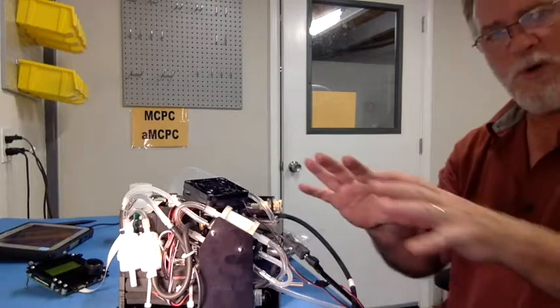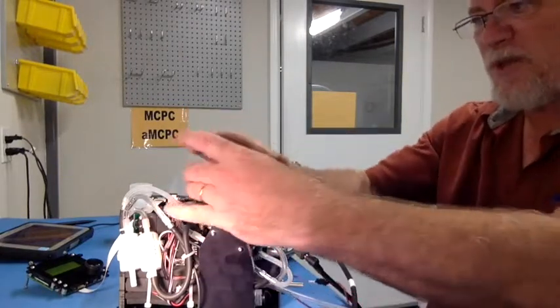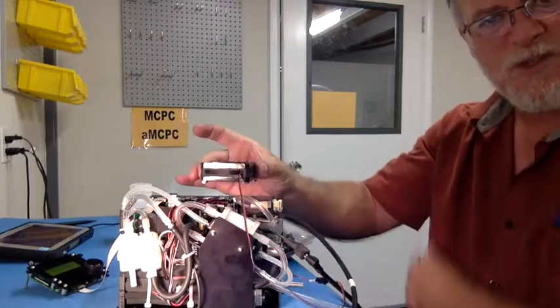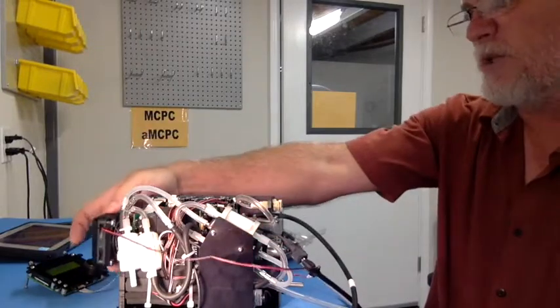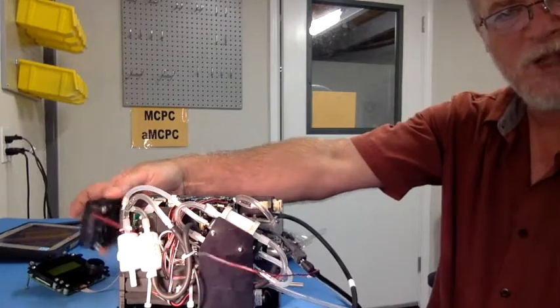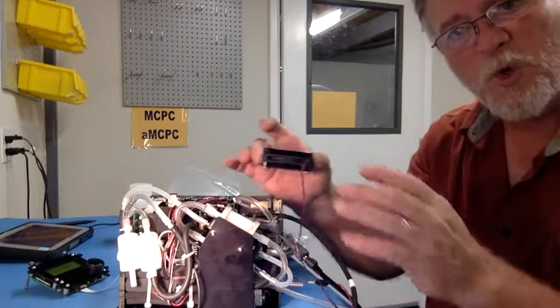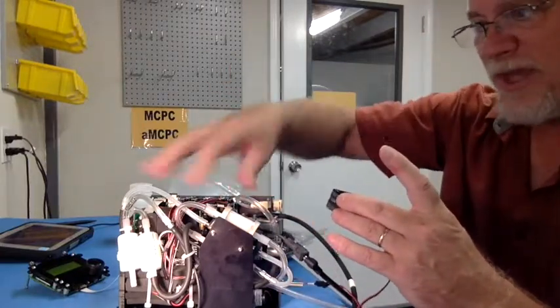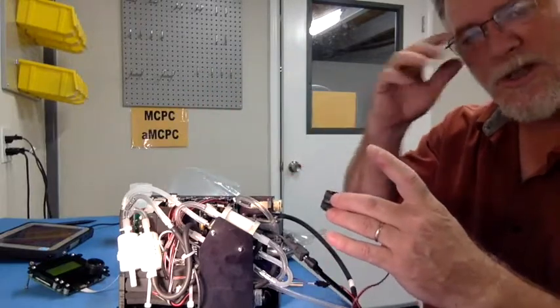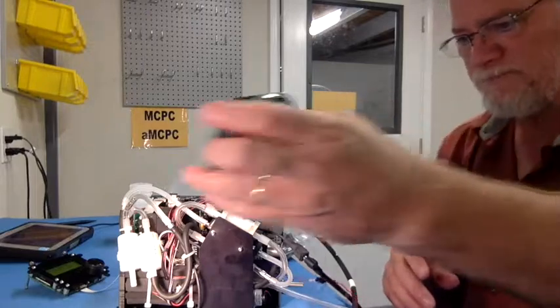Now, when you create your installation and you mount the mixing CPC, you need to find a place to mount this so that it's rigid and held in the right place, something like this. You can blow from the back here as well, behind the unit, but you need to mount this fan, or use some other cooling air that you have available and direct it into the unit so that the unit gets cooling air and can operate as well as possible. Okay?